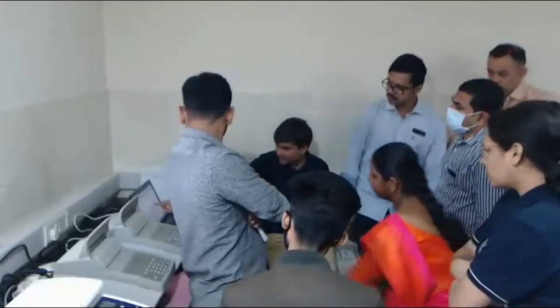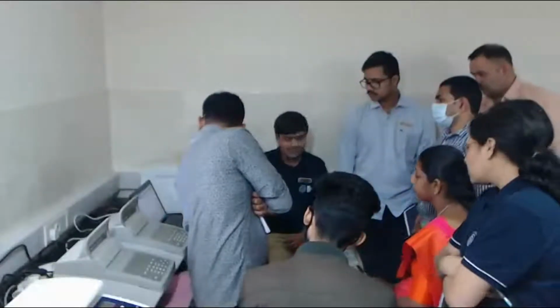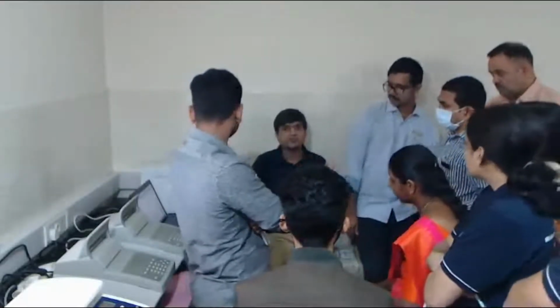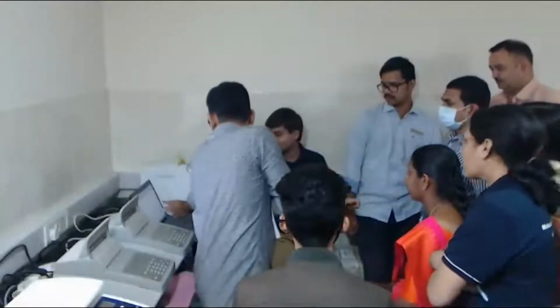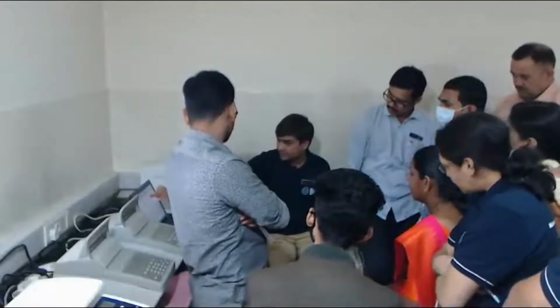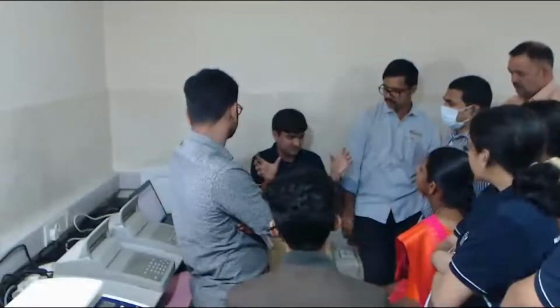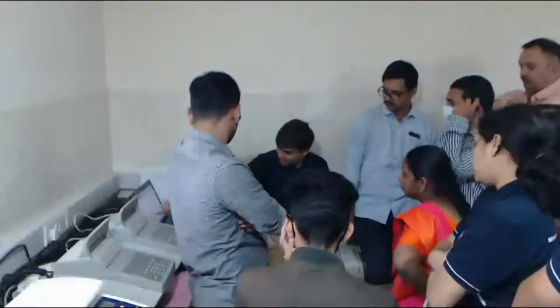Over here, for all the peaks that it has detected, it is showing you the concentration and the molarity of each peak. Can we interpret that it is having four amplicons of different sizes? We cannot say four amplicons. It could be multiple amplicons of the same size as well. So over here you can say that the amplicon of size 402 is more as compared to 480. But then again, to make that comparison, you also need to consider the length of the fragment. Therefore, we look at the molarity.